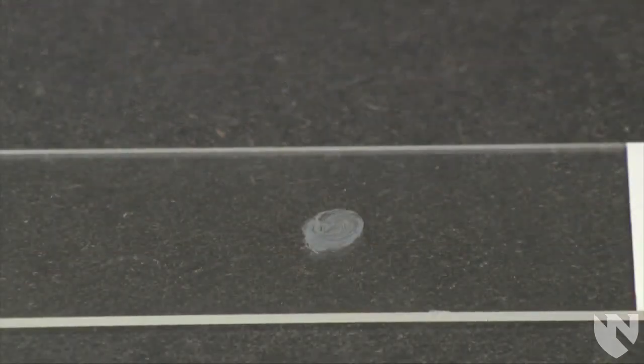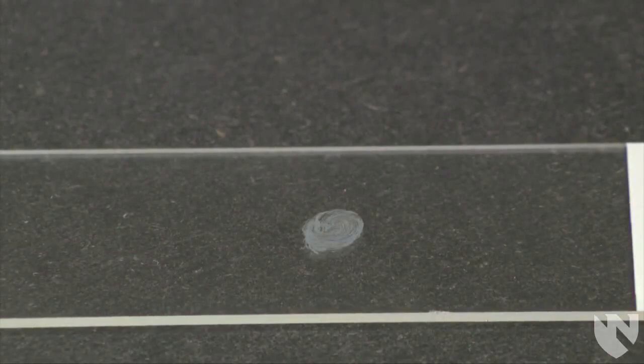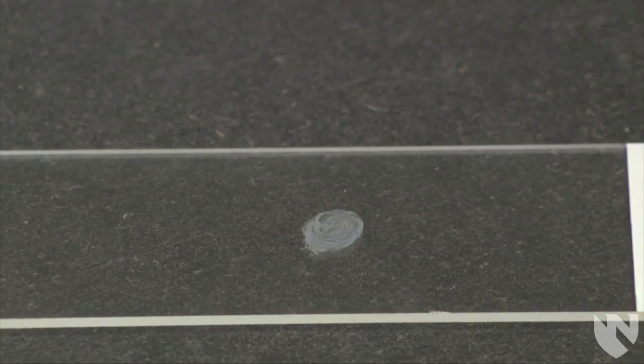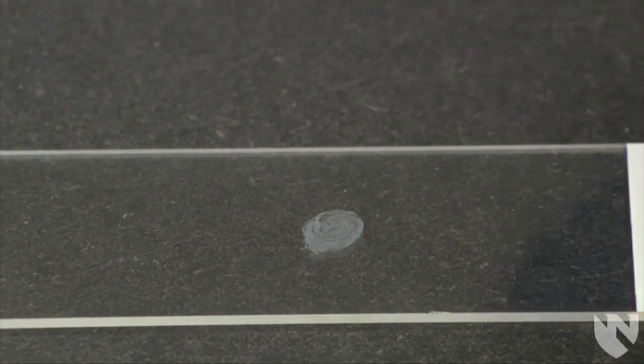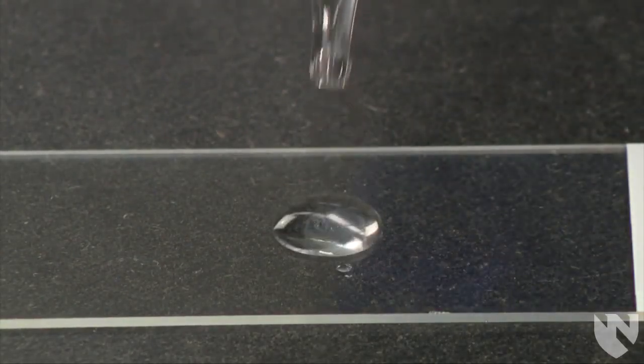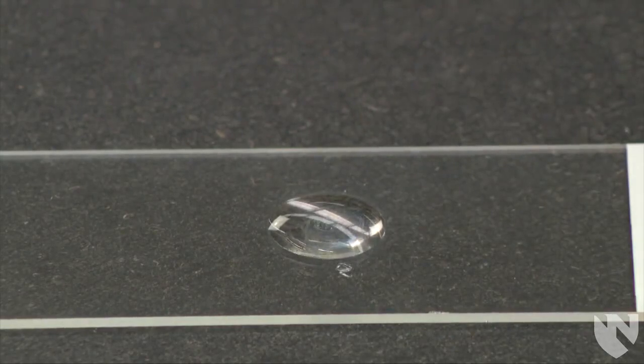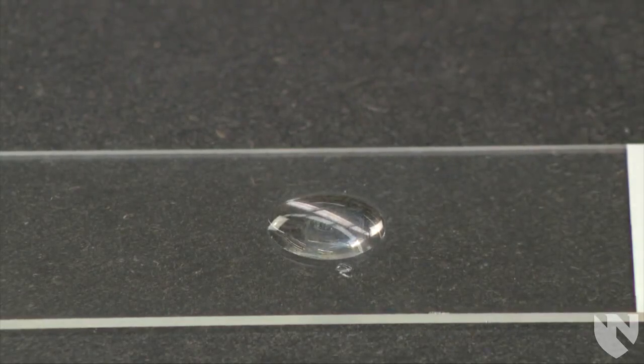Now I am going to perform the test on an organism that is catalase negative. I have already placed the colony on the glass slide and next I am placing a drop of 3% hydrogen peroxide on the organism. A negative catalase demonstrates no bubbling as you see here.